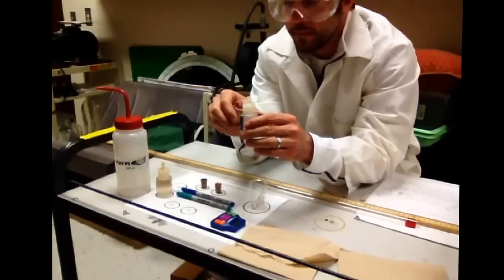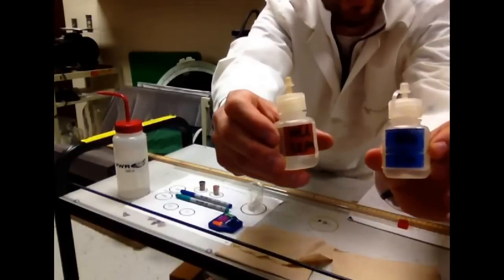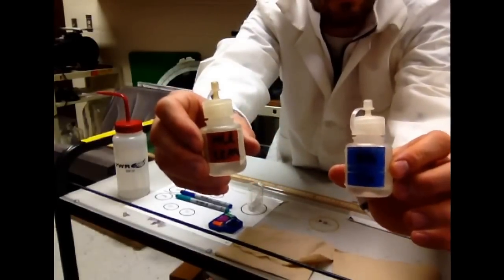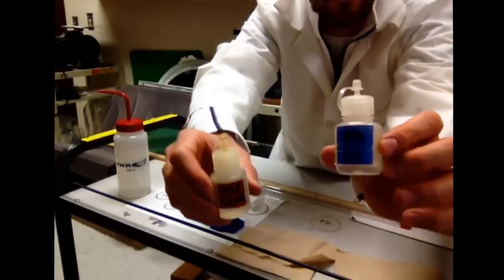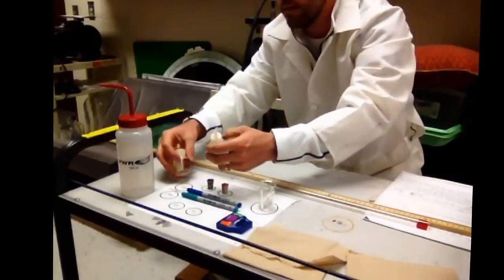What I'd like you to do now is knowing little or nothing about Graham's Law, in the race, do you think that HCl is going to win the race or do you think NH3 is going to win the race? I'll give you a moment to place your bets.